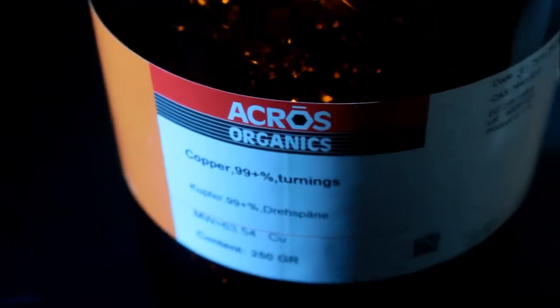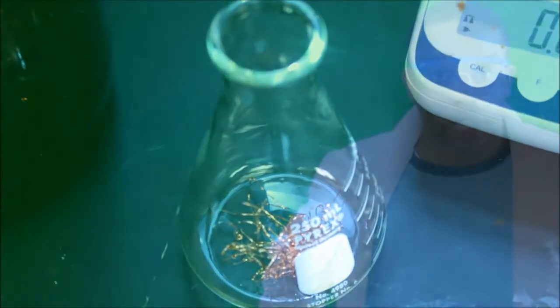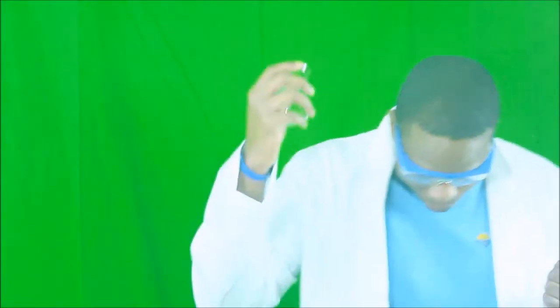Got my goggles, full throttle. I'm in the lab doing Chemistry. Before we start the Copper Cycle, make sure to have on your goggles. Now you got your beaker bottles. Okay, let's do Chemistry, cause Chemistry is what I do and what I do is Chemistry.